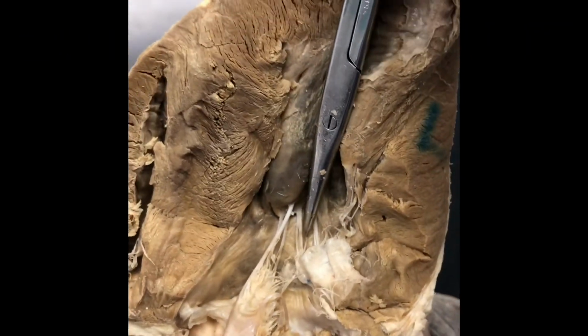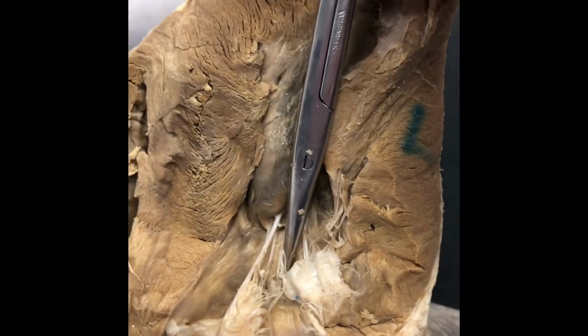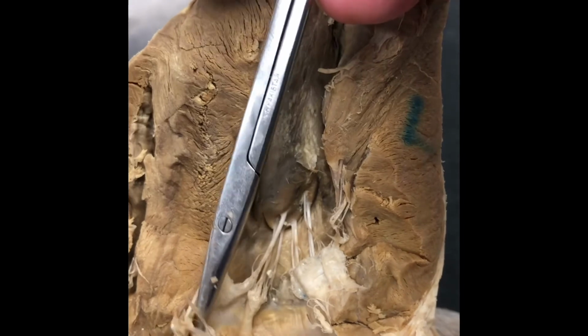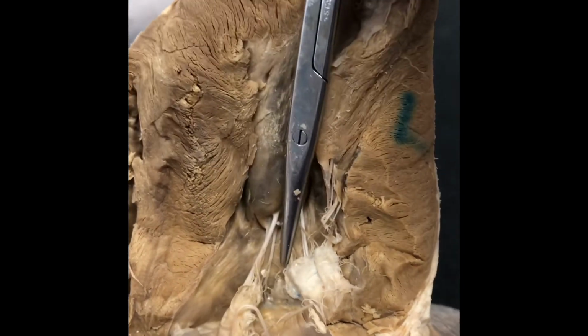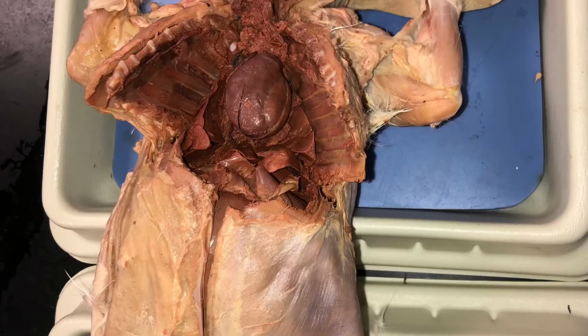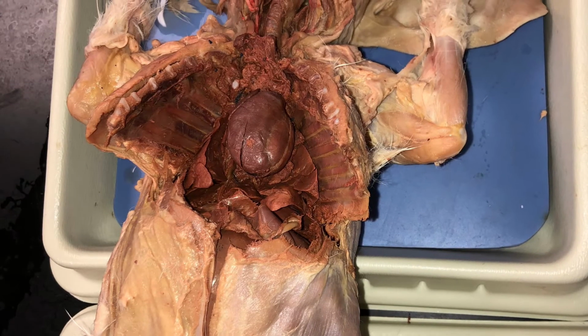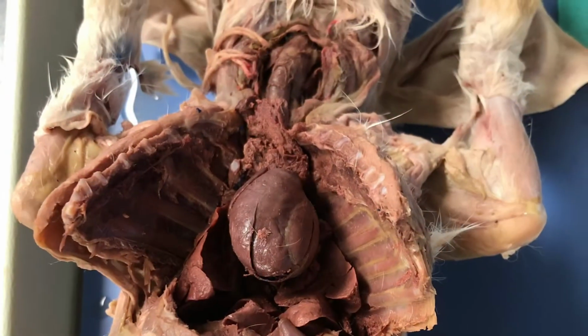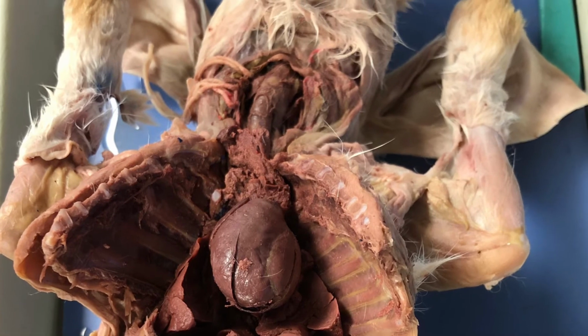So you can really see kind of those strings, and then at the end it has all that tissue, and it really looks like a parachute to me. But those are the valves that open and close to let the blood flow through the heart, but also stop it from backflowing. So again, we have the chest of the rabbit with the heart and lungs. That's the ventral aspect there.